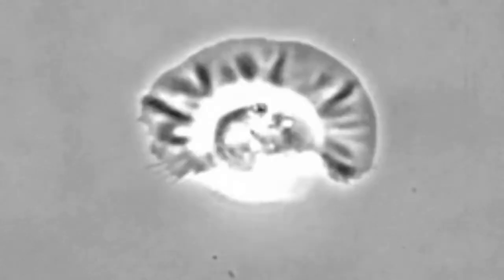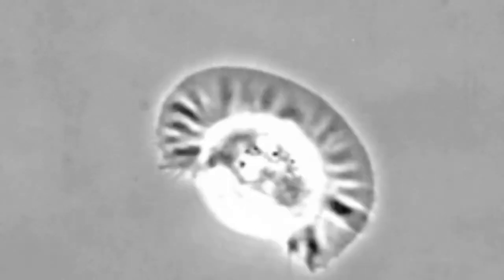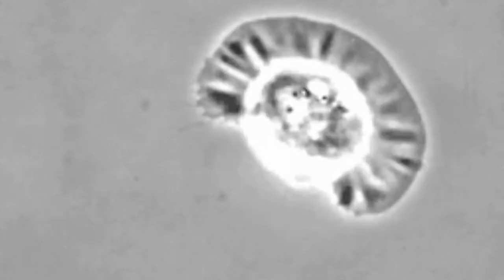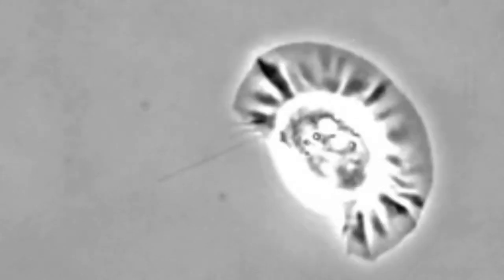This is a cell. It's crawling. It's a fish keratocyte, and scientists study cells like this to understand basic principles of how cells move.